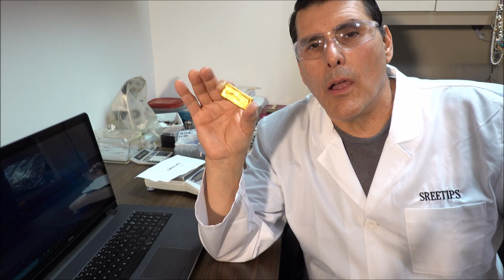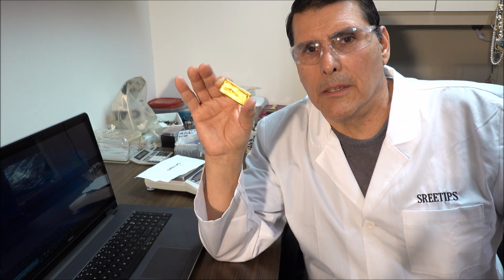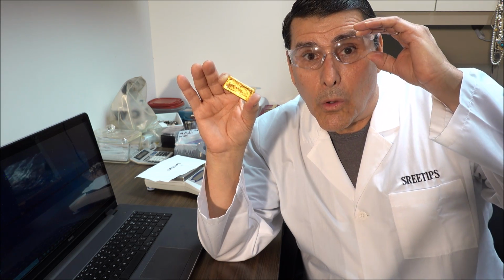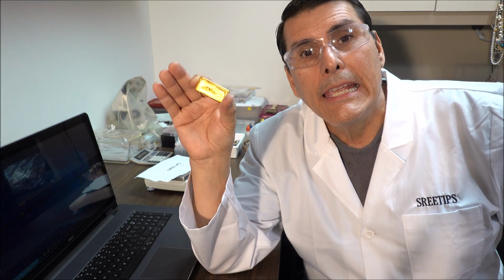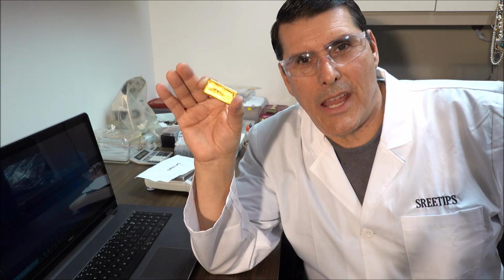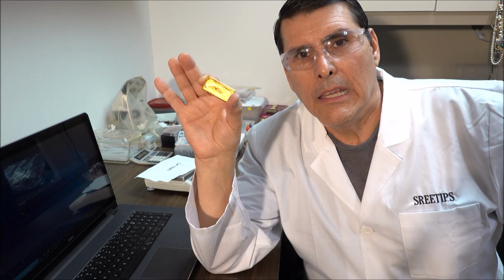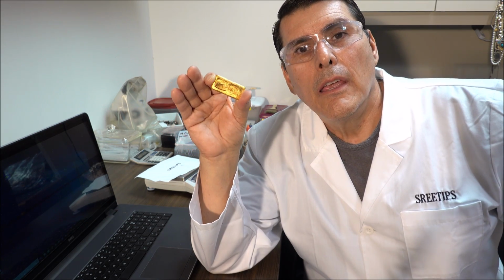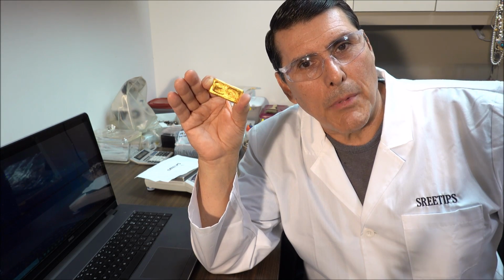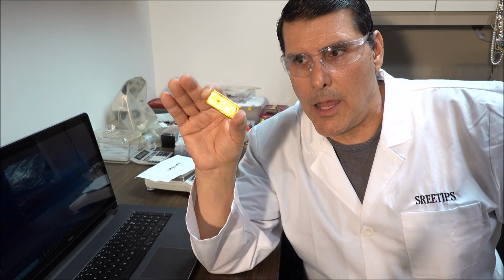We did see, however, how important it is to calculate the correct amount of silver when we go to inquart our gold. If we add too much silver, it falls apart, and we have all the problems that I had in this video. It took me 4 days to get this thing. I'm glad to get it over with. On the other hand, if we don't add enough silver, then the nitric acid will not be able to penetrate, and we'll have a whole host of different problems.